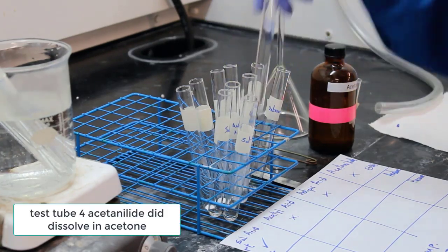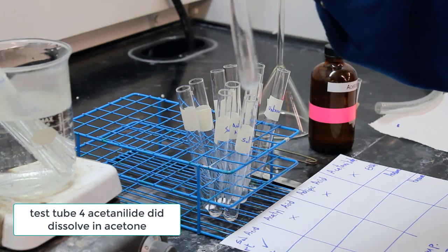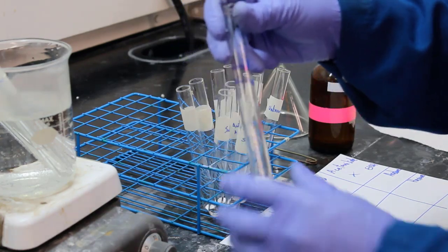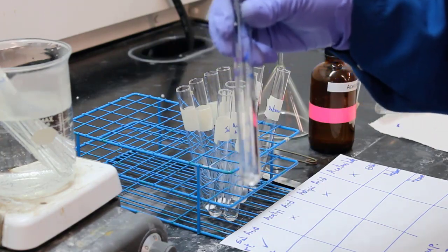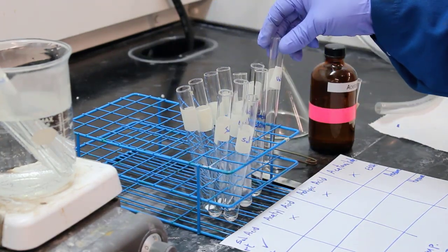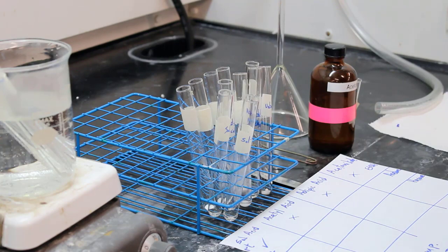Adipic acid didn't dissolve in acetone at room temperature. Acetanilide did dissolve at room temperature in acetone. They didn't add any acetone to the unknown, so they're going to add it.